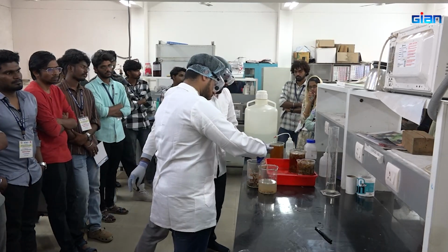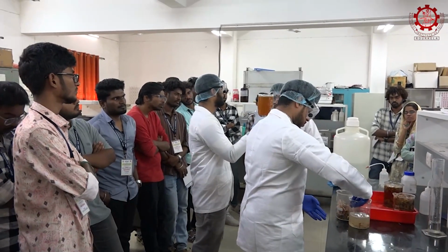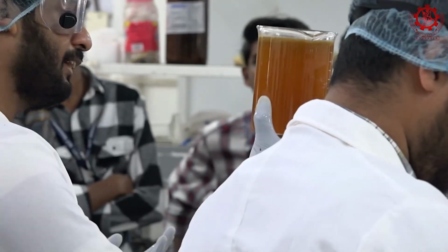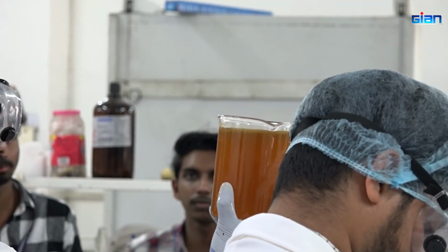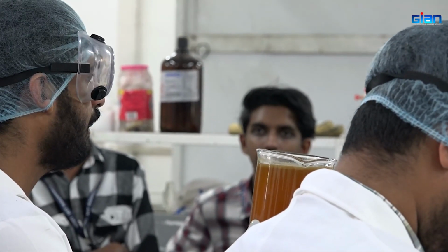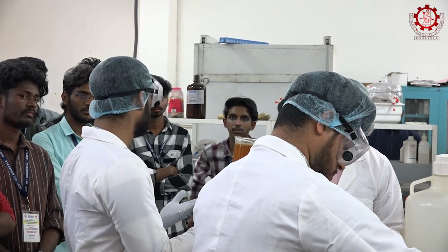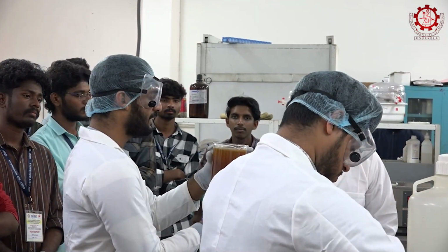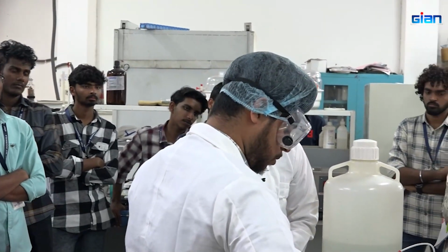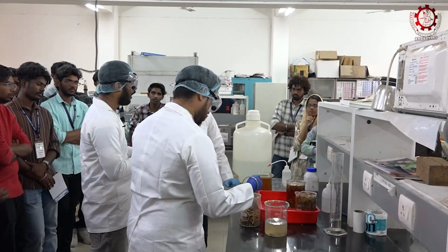Apart from that, as you can see, yesterday we dissolved this shell in the HCl, and it looks like this. What is the composition? You can guess: it contains calcium chloride, and some pigment and other matter might be there, that's why the color looks like this. We will be drying it today and show you tomorrow what comes out, and check the concentration.